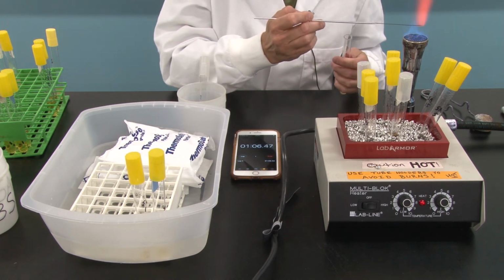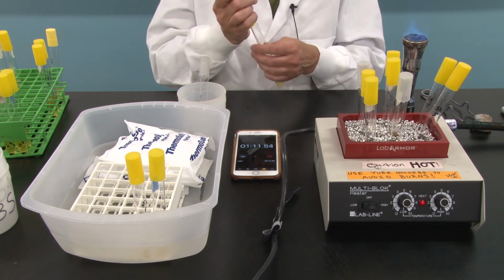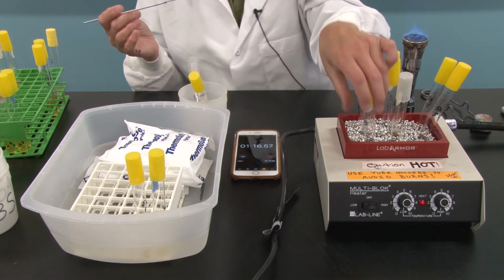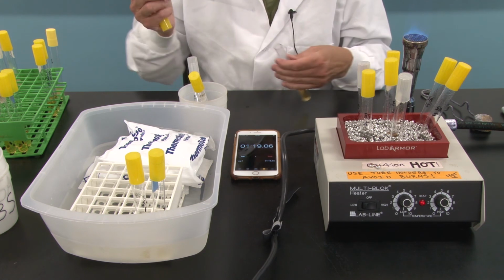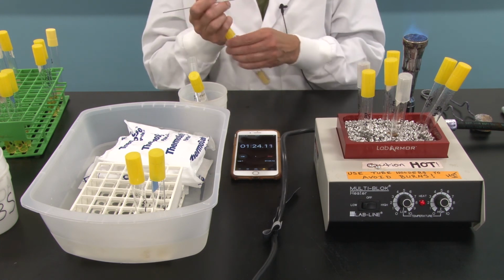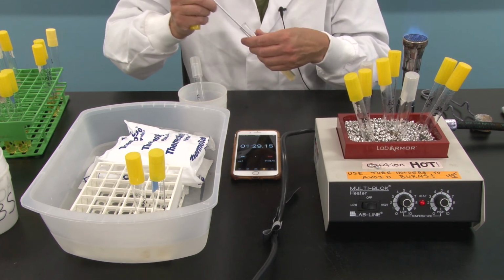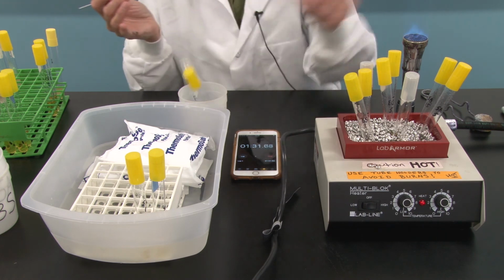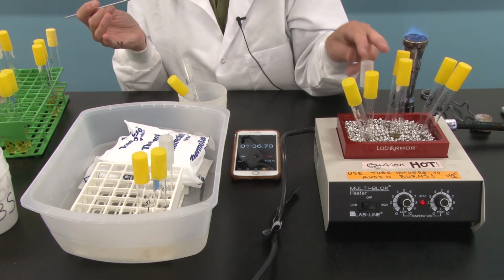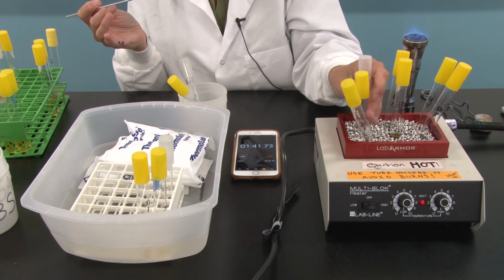I was about a half of a minute in when that first tube of E. coli was inoculated. Now I'm doing a Bacillus subtilis, and I'm going to look at that clock at 20 seconds and inoculate that. And go ahead and get the rest of these Bacillus while we're waiting. And it looks like I'm ready to remove the E. coli. And in another, let's see, few seconds here, I'll remove.